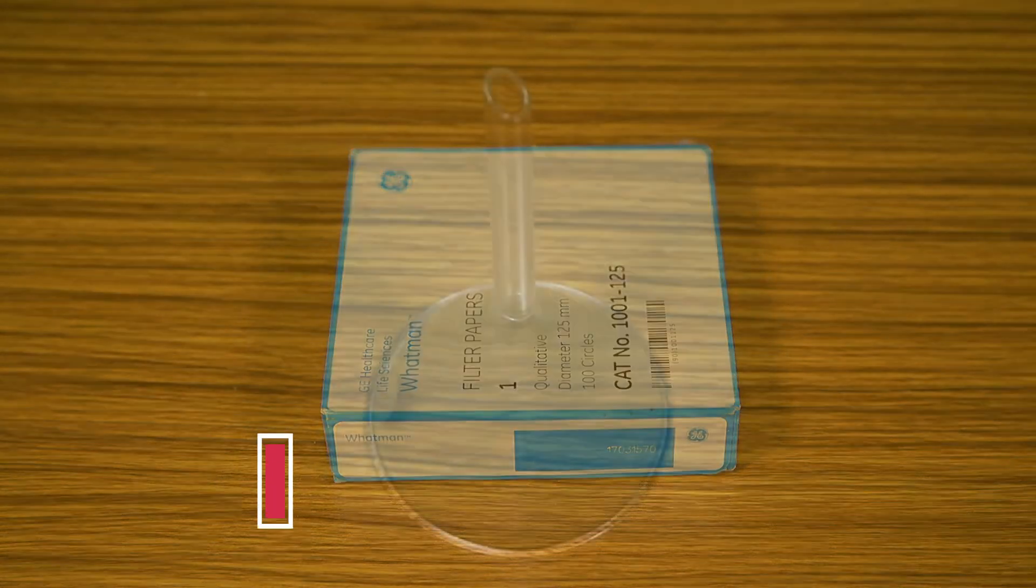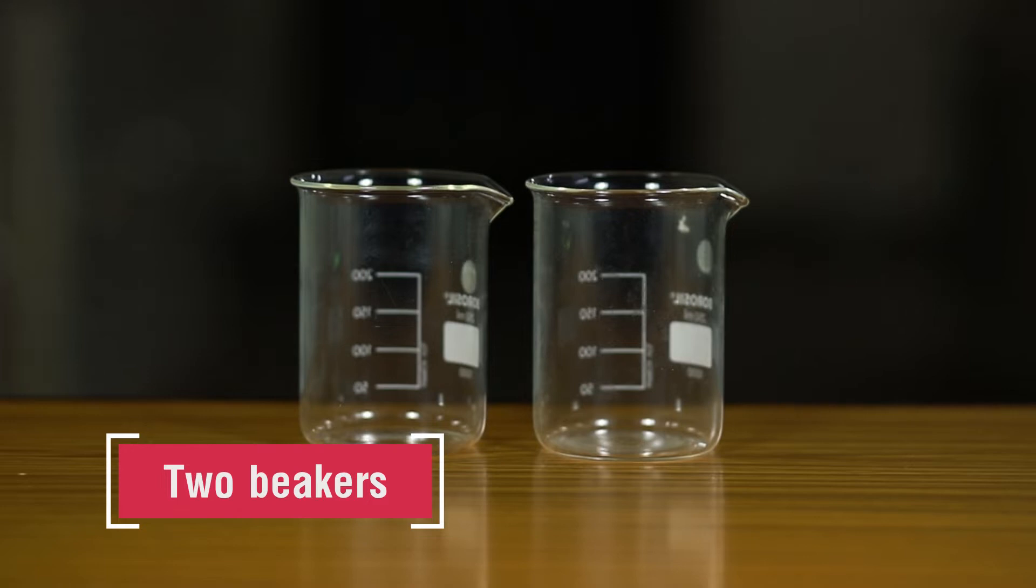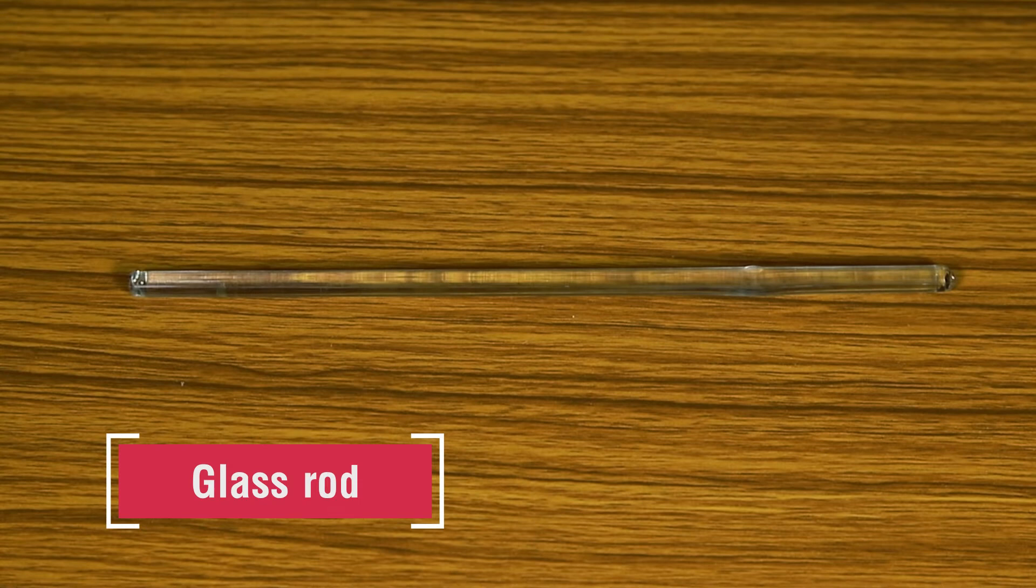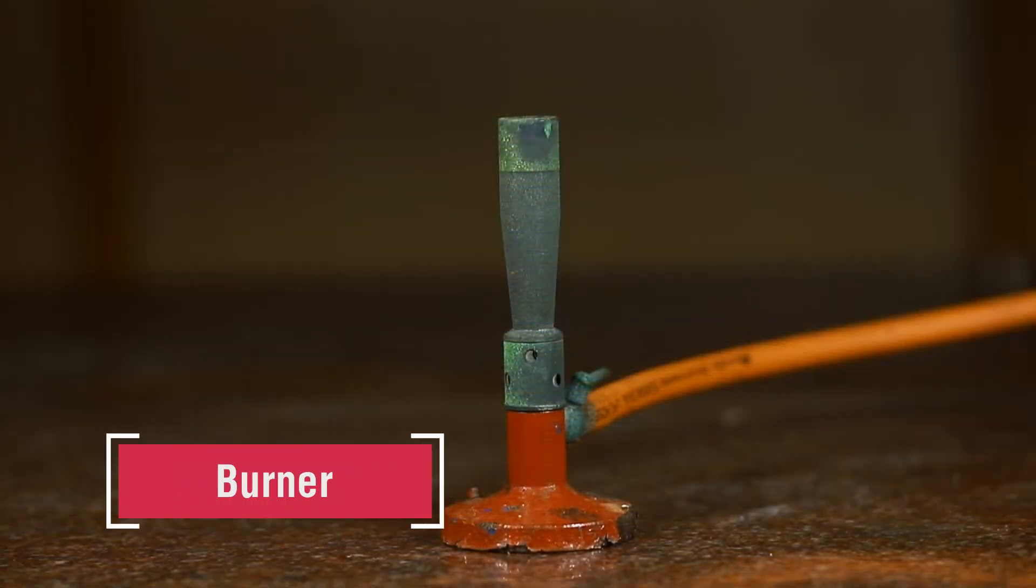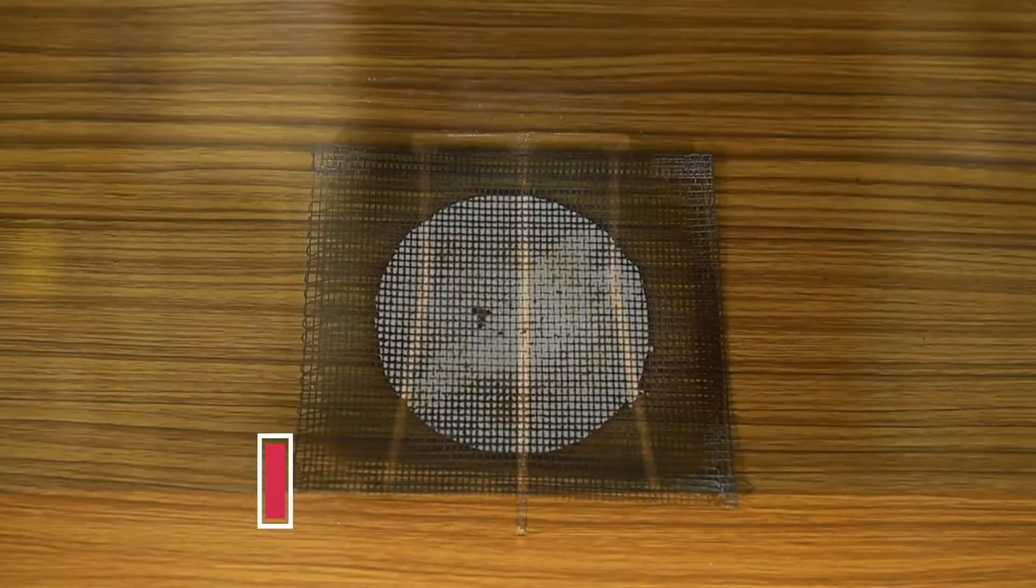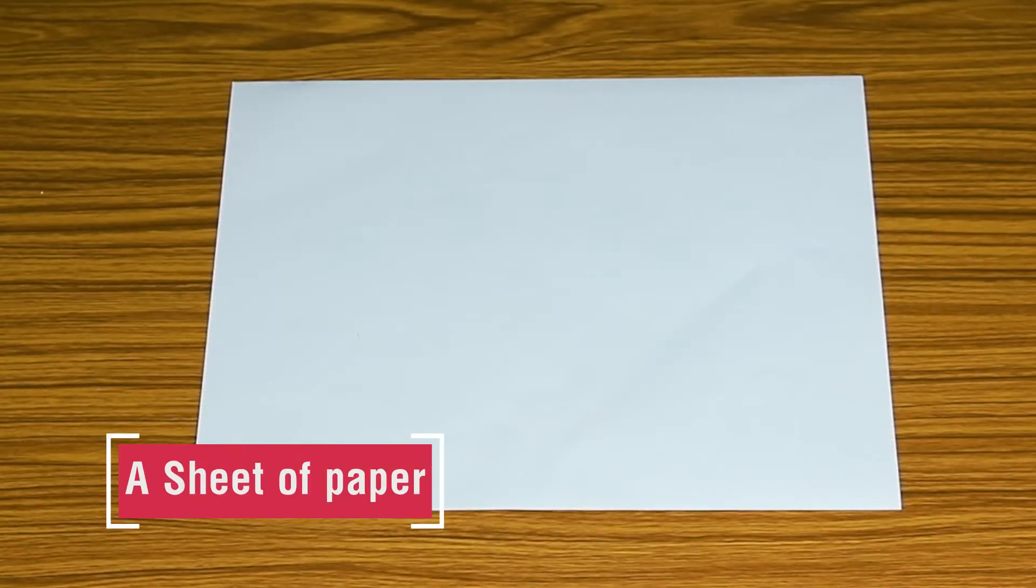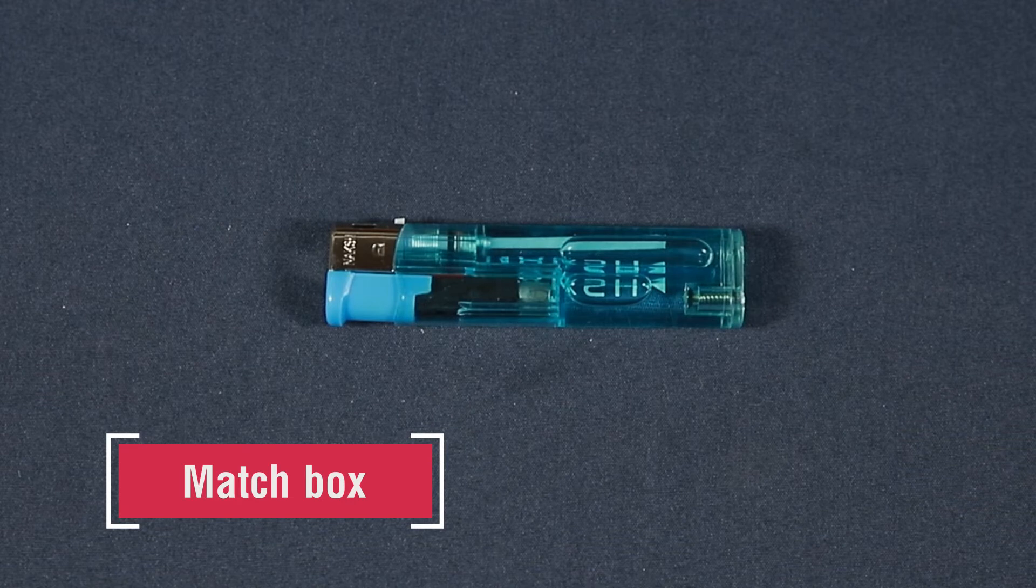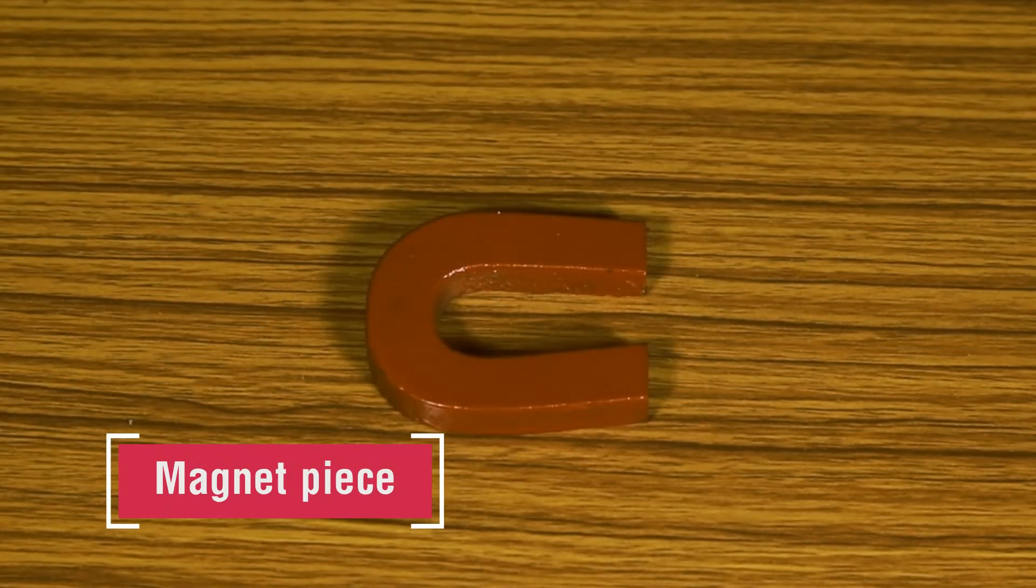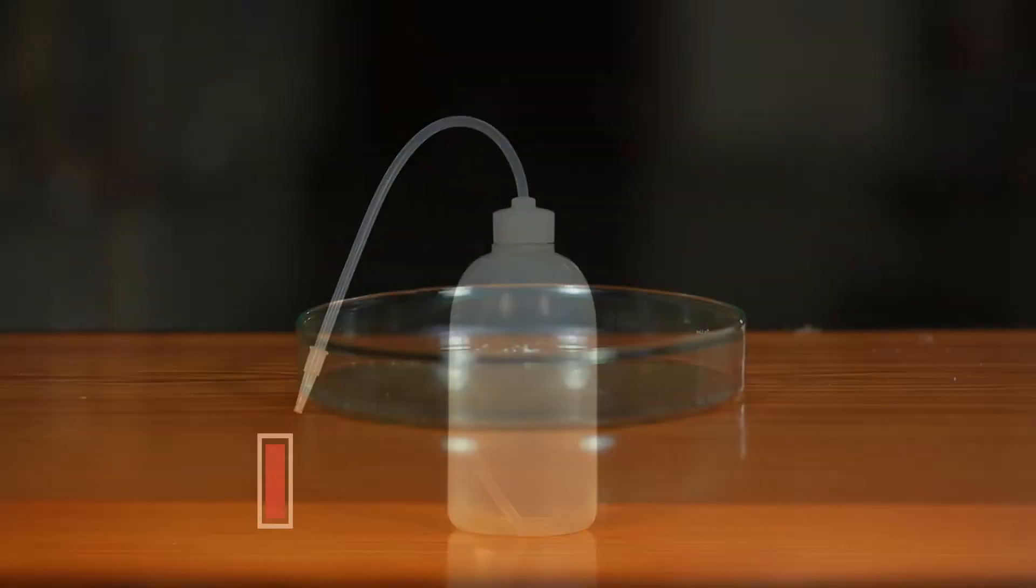Funnel, two beakers, Petri plate, glass rod, burner, tripod stand, wire gauze, a sheet of paper, matchbox, spatula, magnet piece, water placed in a wash bottle.